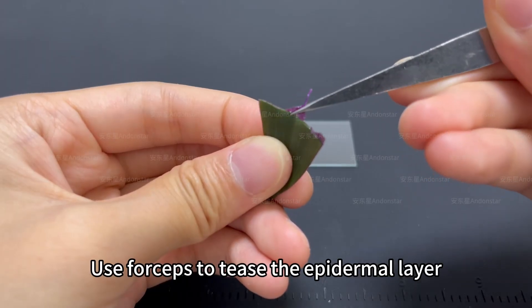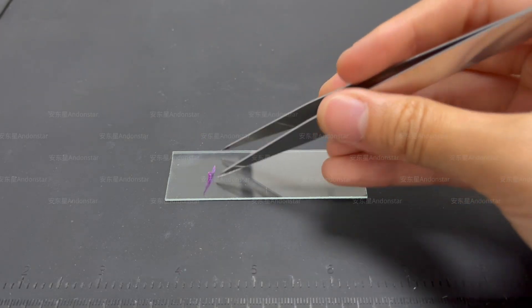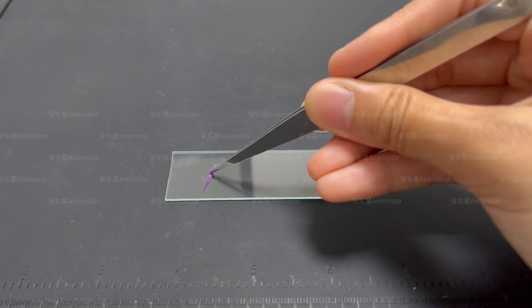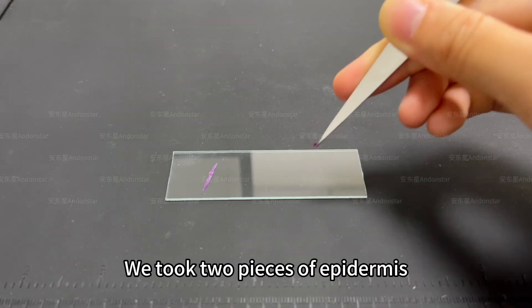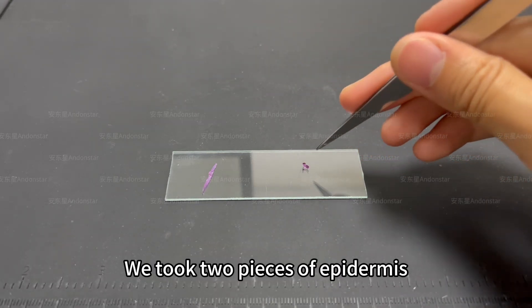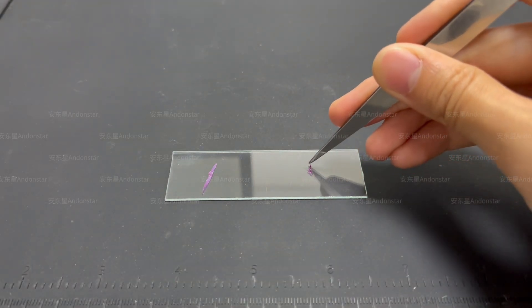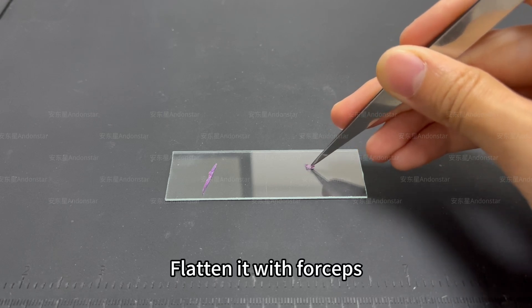Use forceps to tease the epidermal layer. We took two pieces of epidermis. Flatten it with forceps.